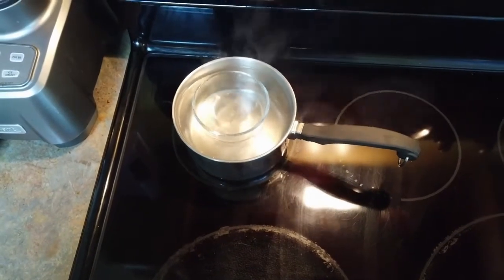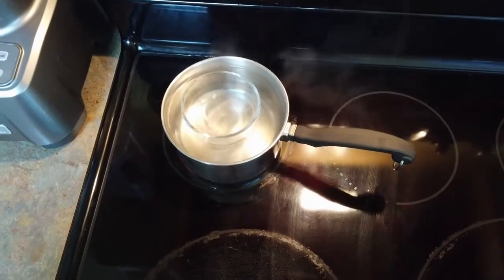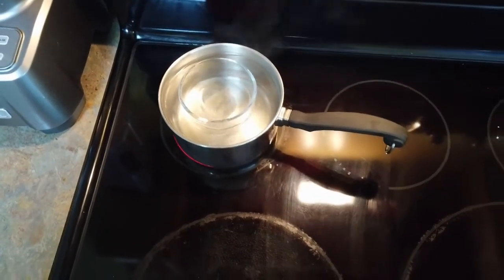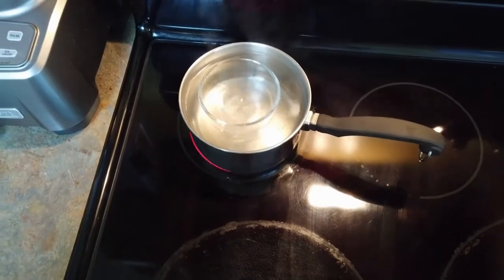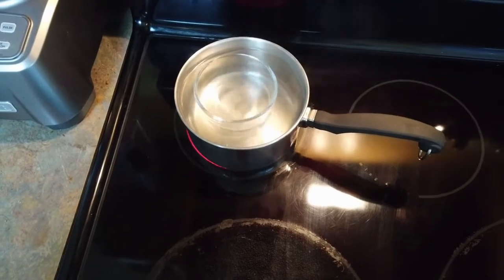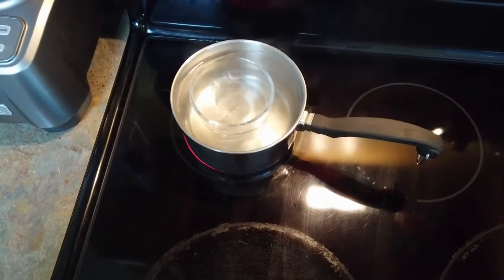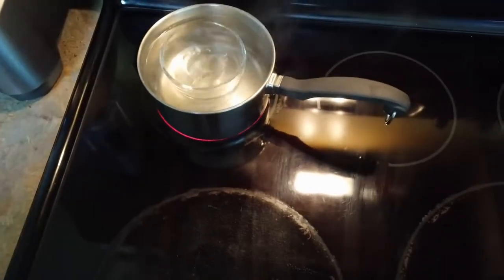So I needed to be able to moisten the swabs, and they said to use bottled water. I didn't really have any bottled water, so what I did was I boiled this container, this little Pyrex container, which I'm going to have also some boiled water in there, so it'll be sterile water in a sterile container. And I have my gloved hand I will take this out with.